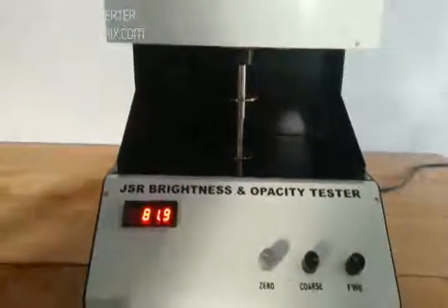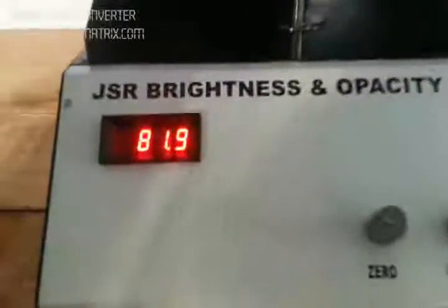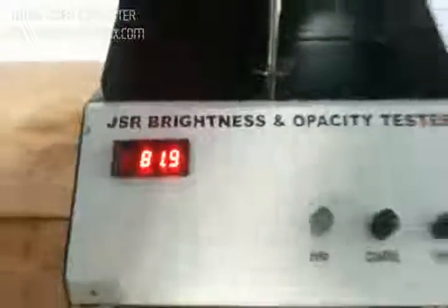After 10 to 15 minutes, we are able to take the test. Then we place the white paper sample over the tile. This will show the brightness of that paper sample, which is 81.9 percent.